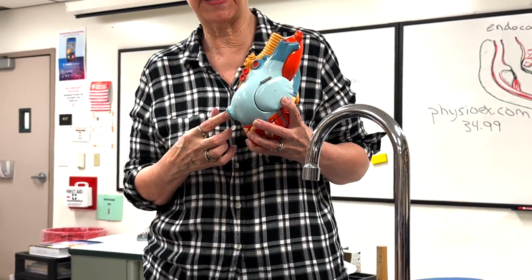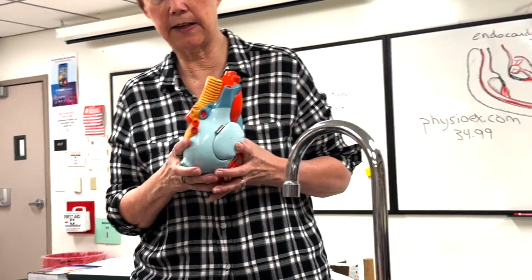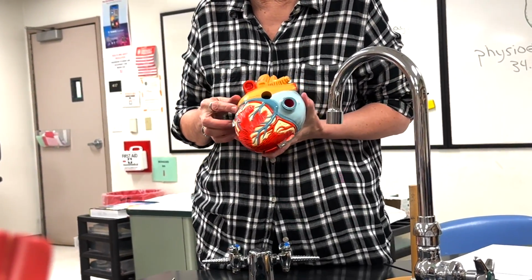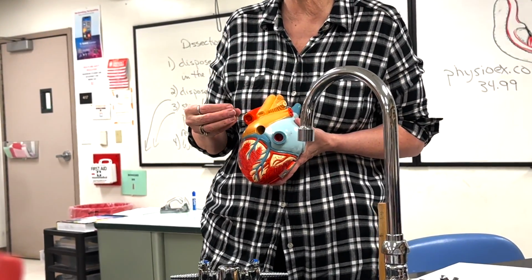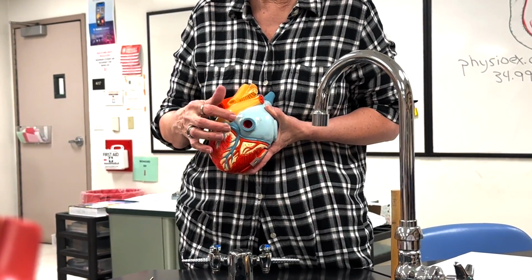From the abdomen and the lower limbs, it comes through the inferior vena cava. And then from the heart, the great cardiac vein, which starts here in front, goes around the side. It dilates to become the coronary sinus. So the blood that the heart has used to contract gets deoxygenated, and that's how it returns. It doesn't go very far, back to the right atrium.